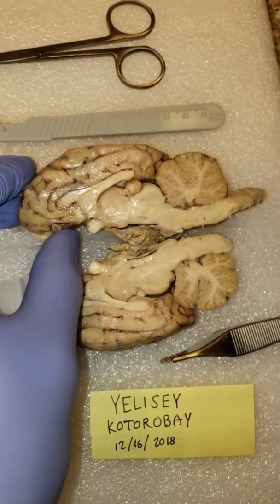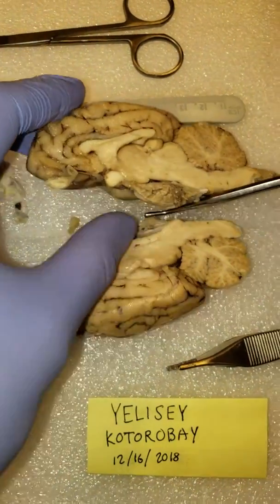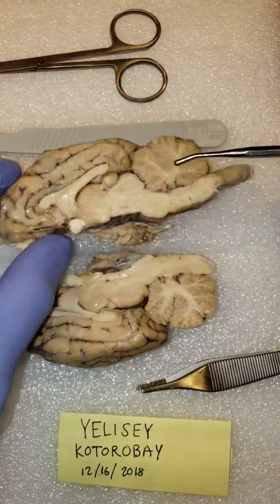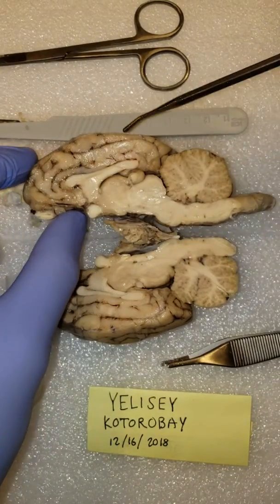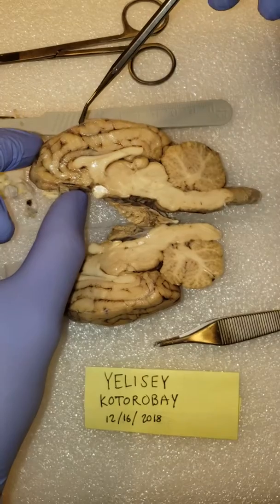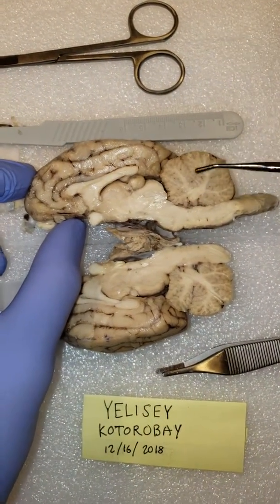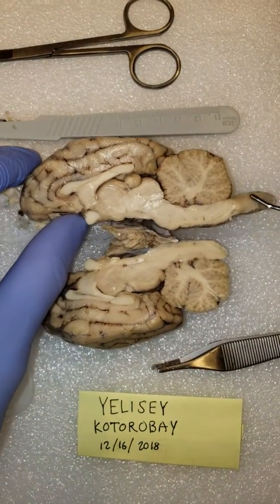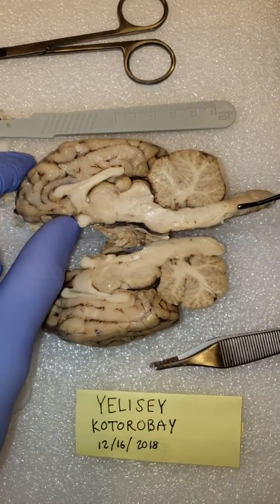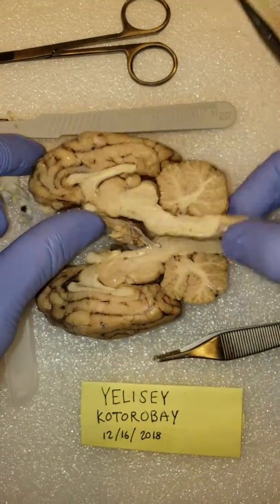Last but not least, I'm going to run through a quick portion here of everything we have from the side view, basically a mid-sagittal view of the sheep's brain. At the top, we've got our cerebral hemispheres. You can also see the gyri and the sulci here from this portion as well. We've also got the cerebellum in the back. We've got your brain stem. You'll notice that the positioning of the brain stem is to the back, since sheep walk on 4 legs and not on 2. Otherwise, their brain stems would be at the bottom, underneath their heads.